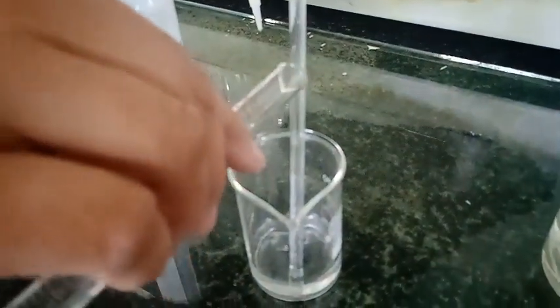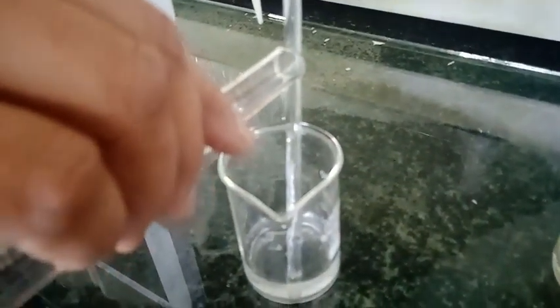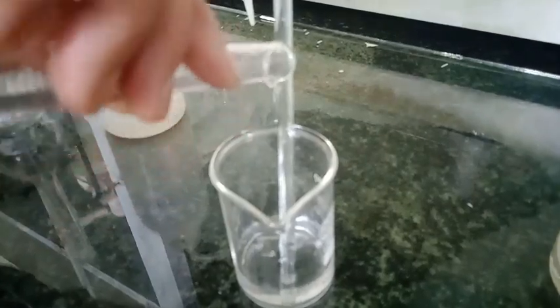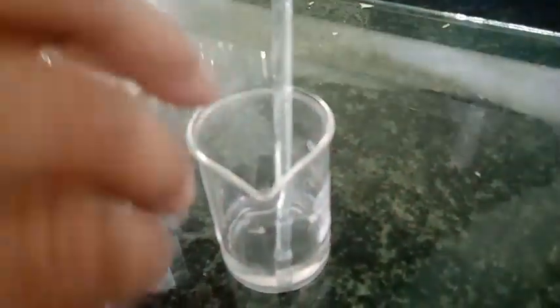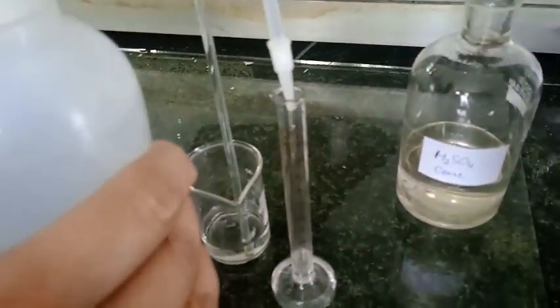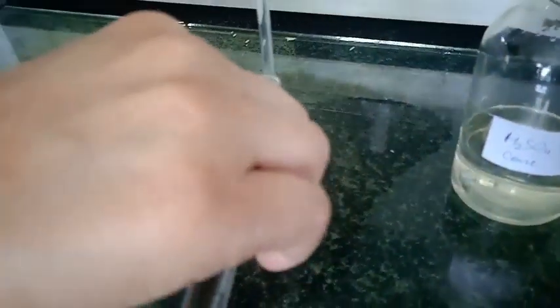Here you can see I am adding the acid to the water. This is done because in this way there are very, very less chances of bumping.